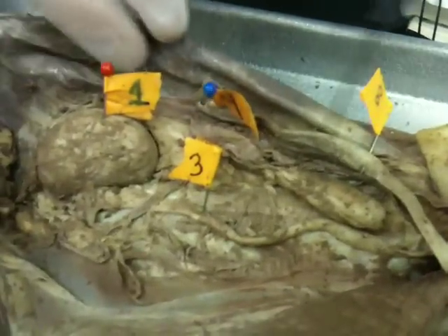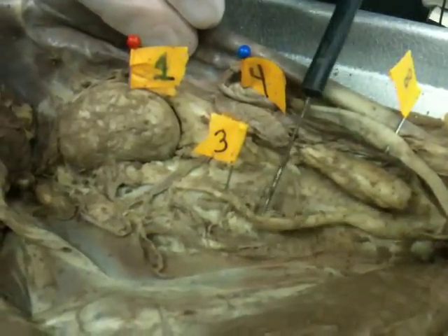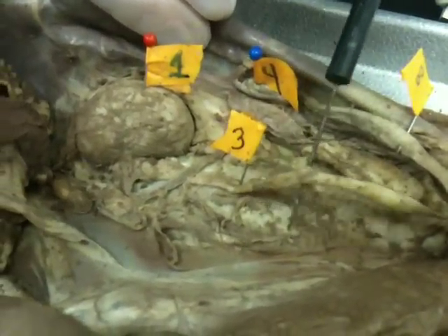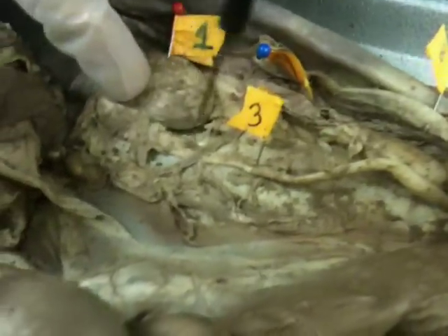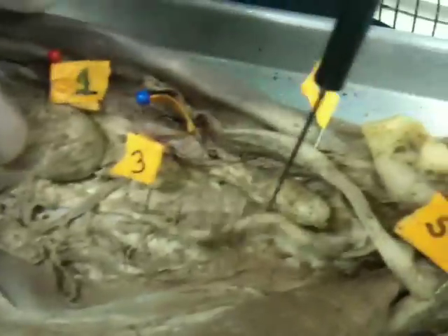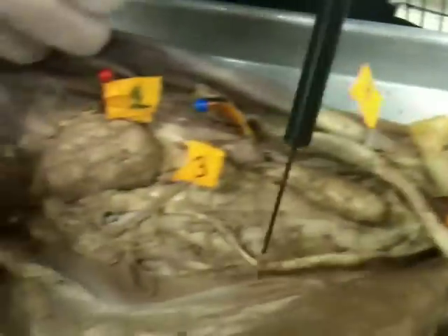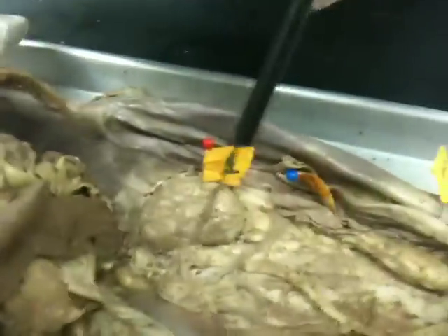Next, we move on to the ureter, which is the tube running from the kidneys all the way down into the urinary bladder. Here is the ureter, which is just this tube connected to the kidneys.